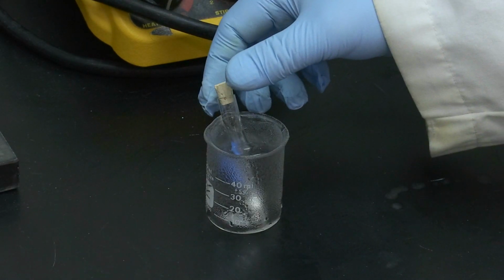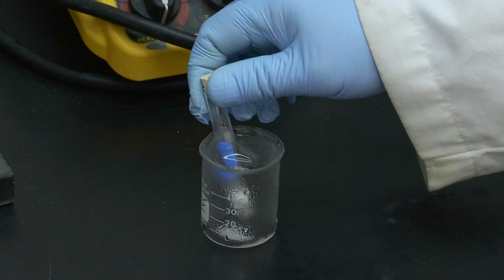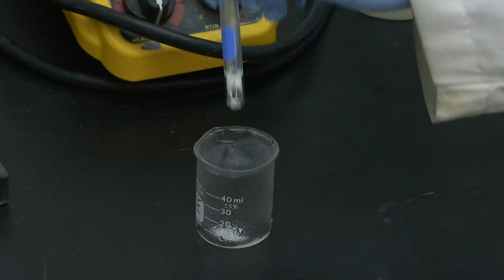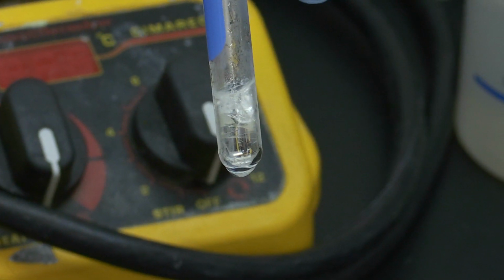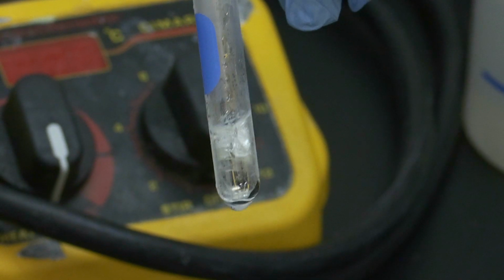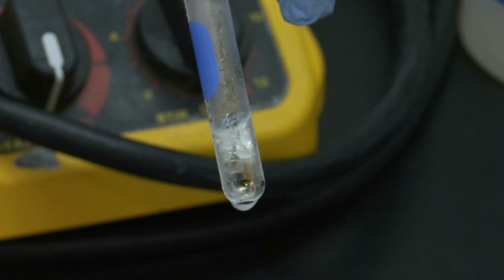So we've reacted the styrene to produce polystyrene for 75 minutes, put it in an ice bath to cool it. That's the result of the produced polystyrene. Now we're going to remove it from the glass and take a segment out to do solubility.